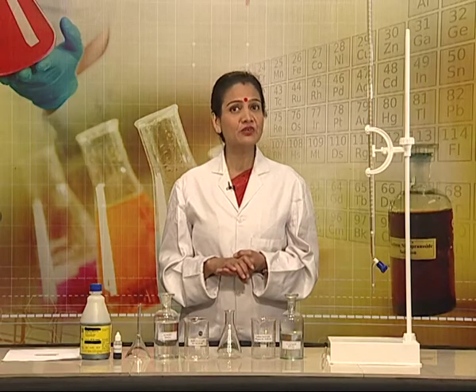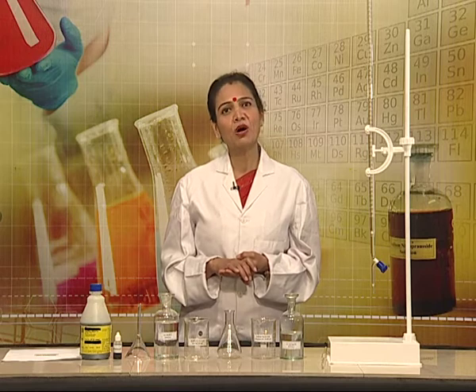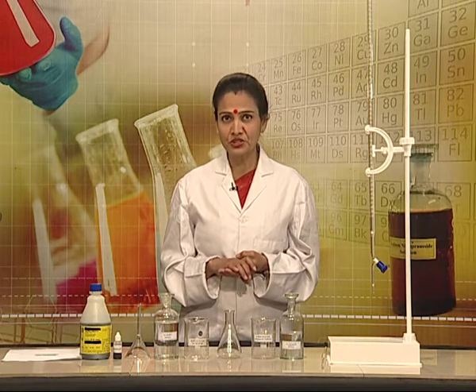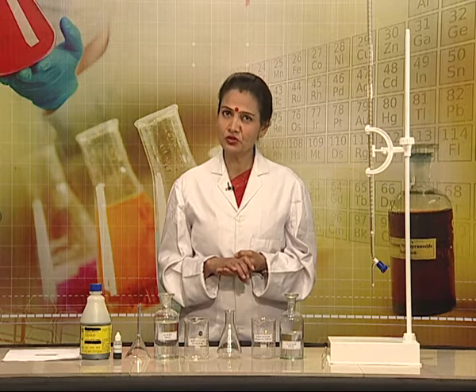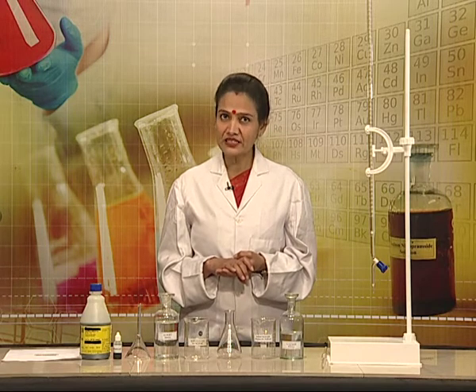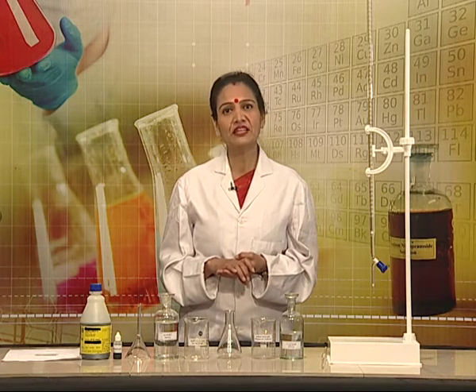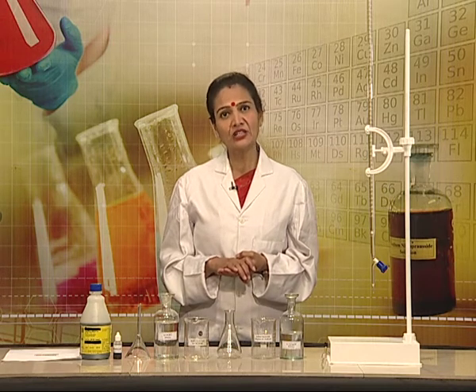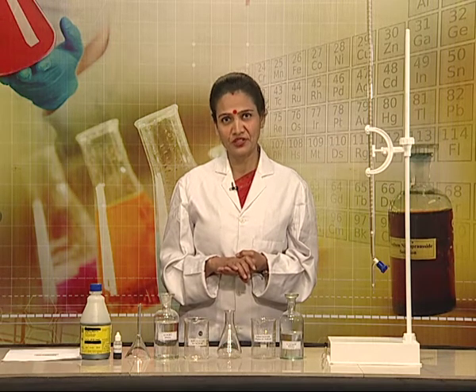We will focus on the neutralization process of strong acid and strong base solutions, and try to understand how the amount of hydrogen ions changes in solution during the process of neutralization. For this, we will use titrimetric analysis method to determine hydrogen ion concentration in solution.